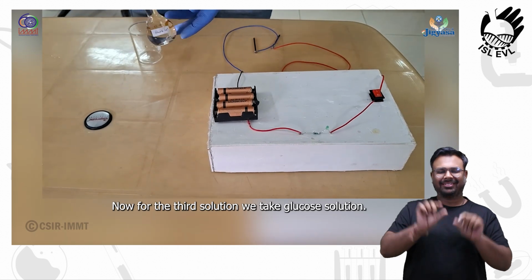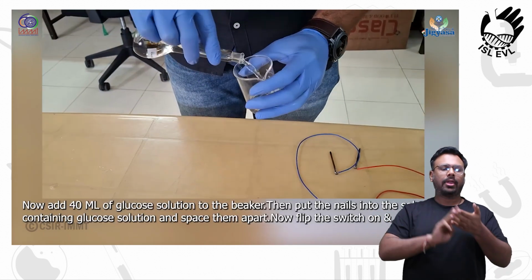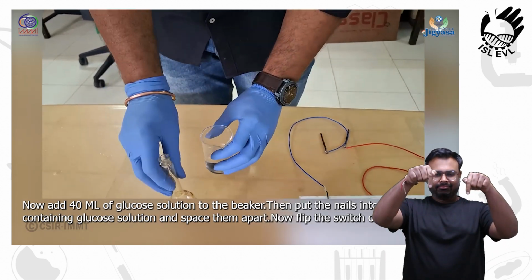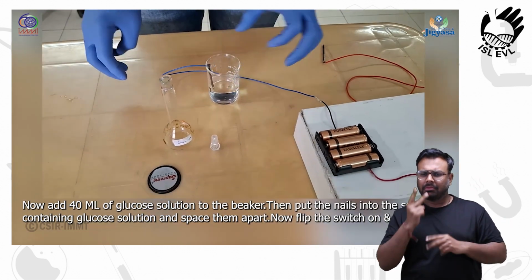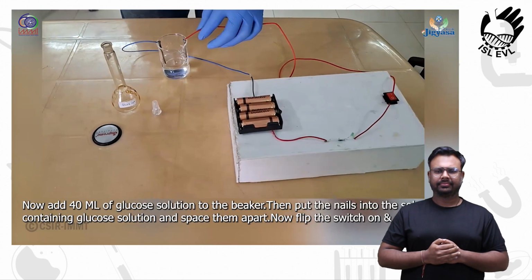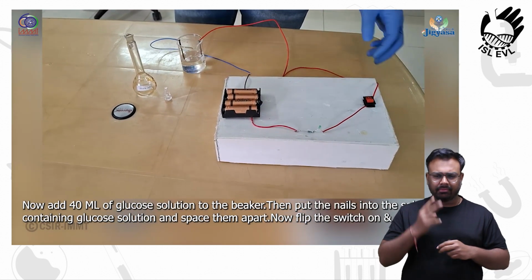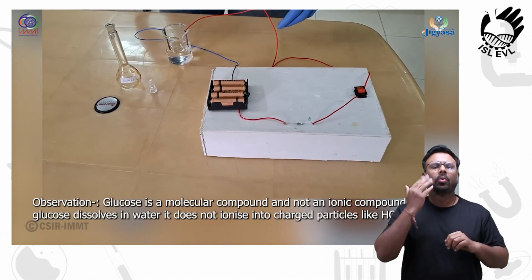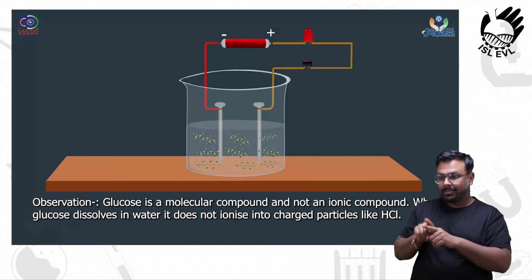Now for the third solution, we take glucose solution. Now add 40 ml of glucose solution to the beaker. Then put the nails into the solution containing glucose and space them apart. Now flip the switch on and observe. Observation: glucose is a molecular compound and not an ionic compound.